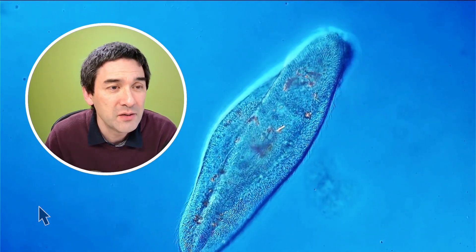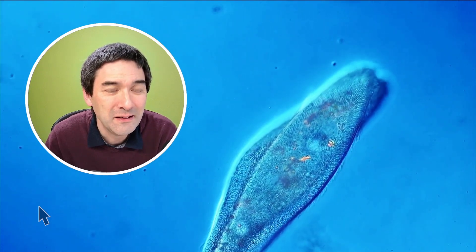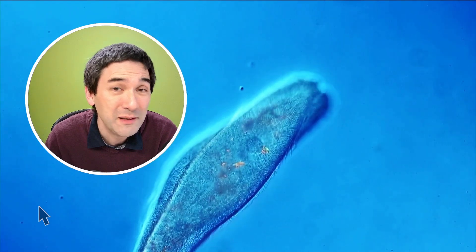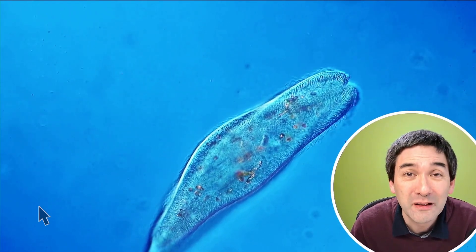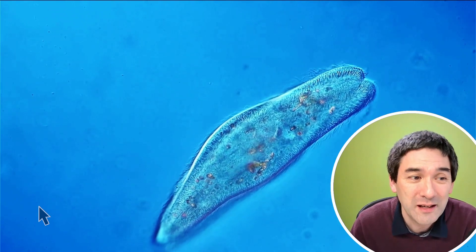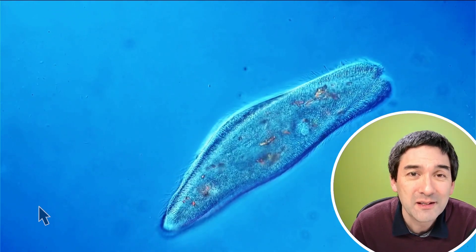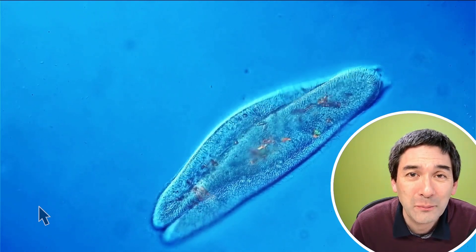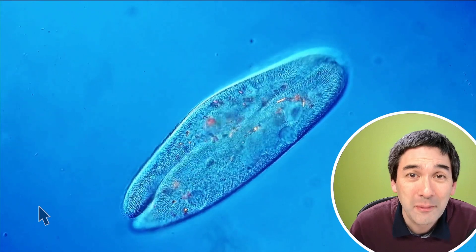I also like this one over here. You can actually see the individual cilia beating. For me, it's always a little bit surprising how coordinated they're moving — because even though they're fused together, they're moving like one single organism. So even their movement has to be synchronized. Then after some time, they're going to separate again and go their own paths, and then they can simply reproduce again by cell division.